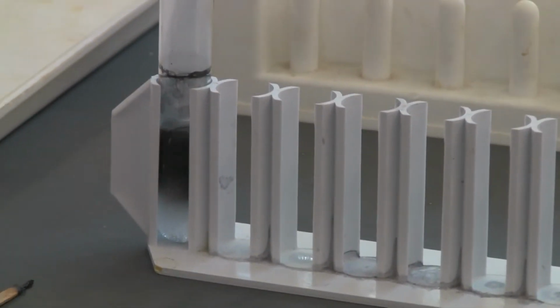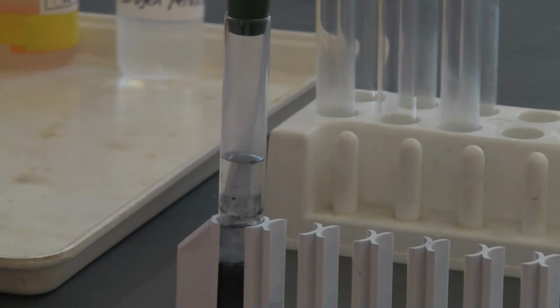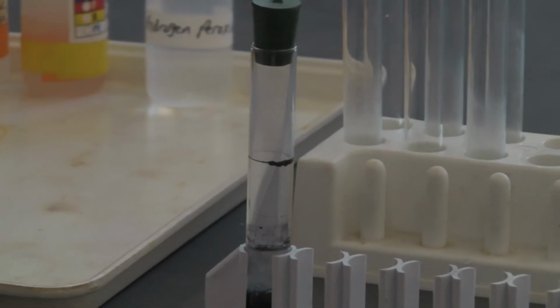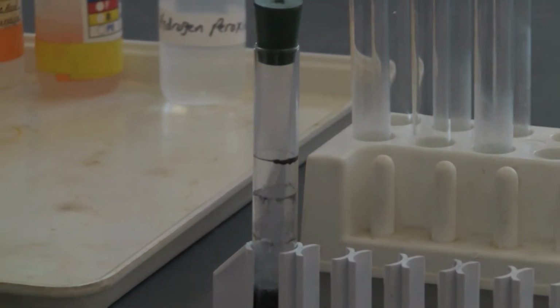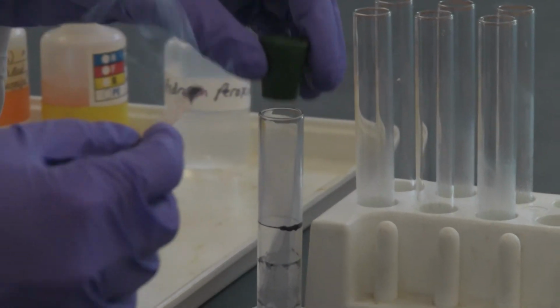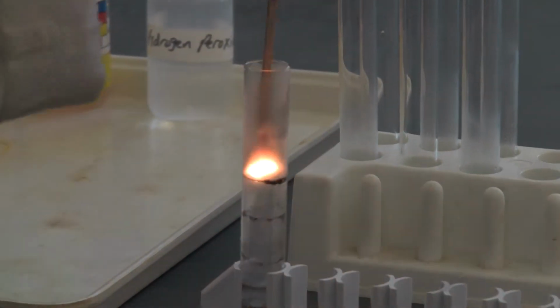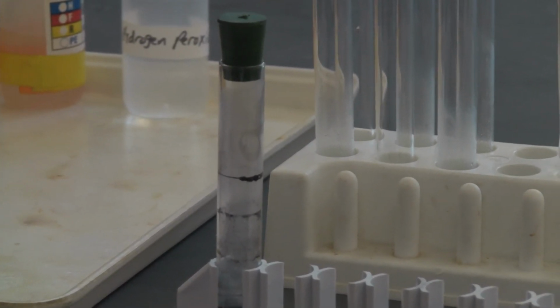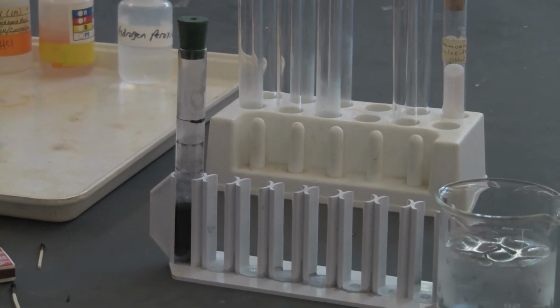Now we're going to see if there is any gas formed. What kind of gas is forming? Would you expect to hear the pop again, or is this time a different gas? Let it glow in. Ooh, it reignites. Do it again. Ooh, it reignites. What gas will support combustion? Think about it. You can see the catalyst really makes a big change in the reaction.